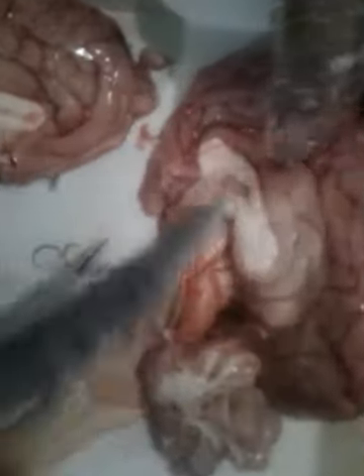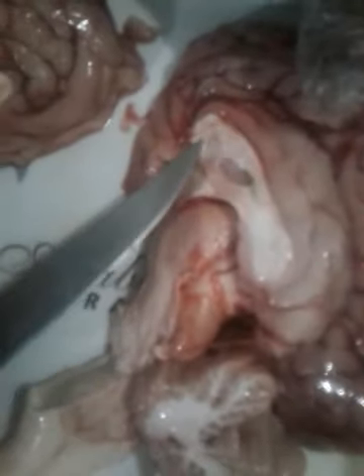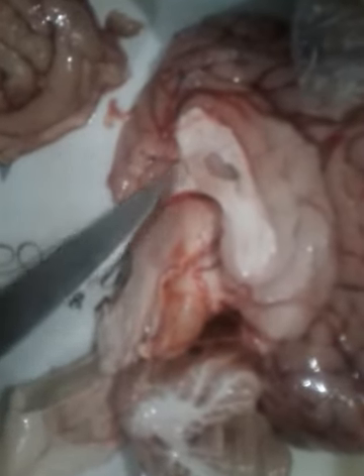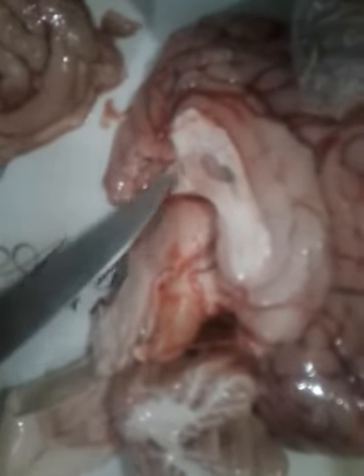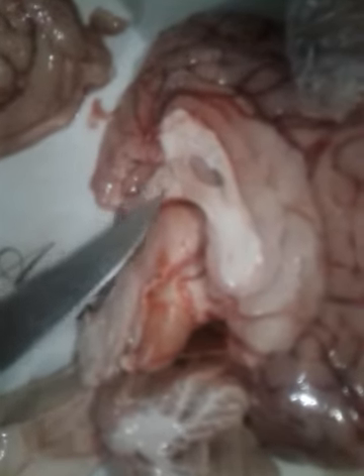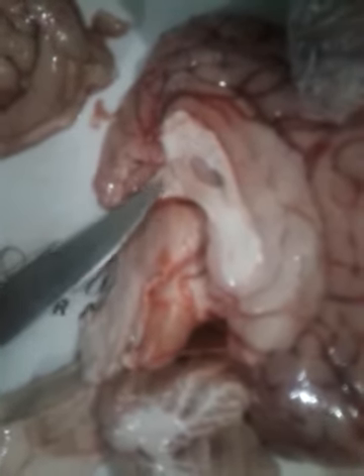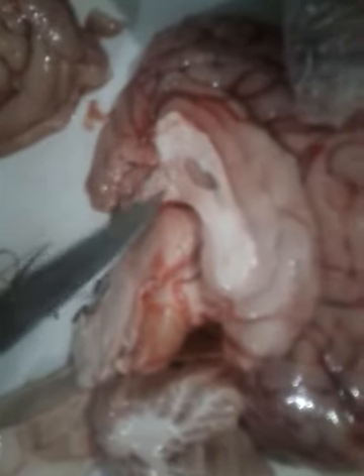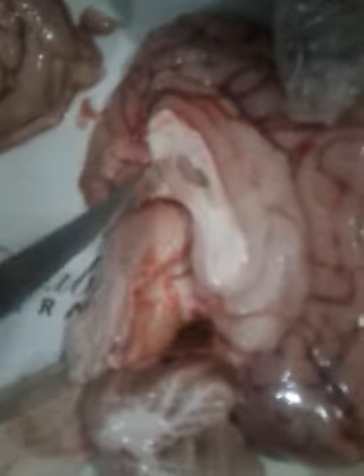Okay, now focus on this portion. This area is known as thalamus. This is the thalamus, and below this you will find the hypothalamus. The hypothalamus is the area from where you will find a hormone, ADH, which controls the water balance, or osmoregulation. And you will also find different hormones produced in this area of the brain.